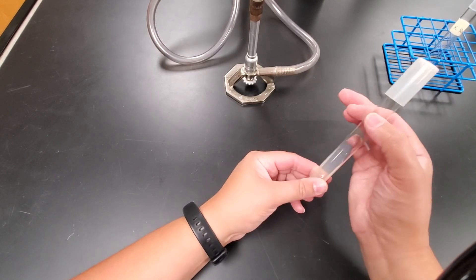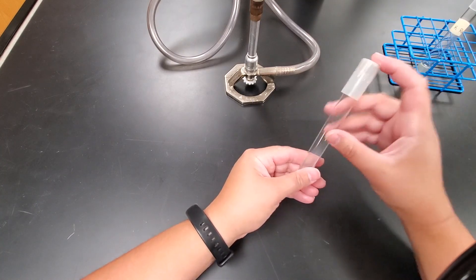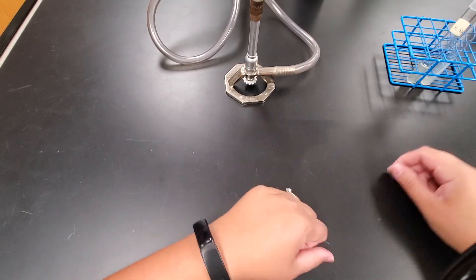Once again, I'd put my masking tape up here, and then we're going to stick it in the incubator. Once it's in the incubator, we leave it in there for 24 to 48 hours, and then we look at the results.